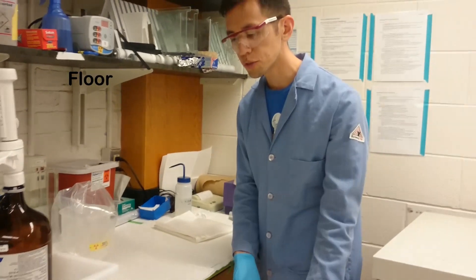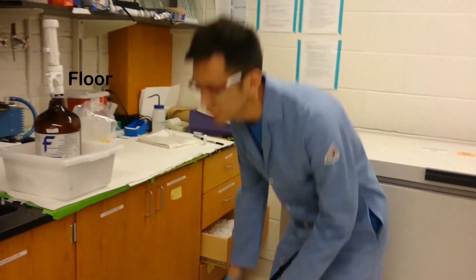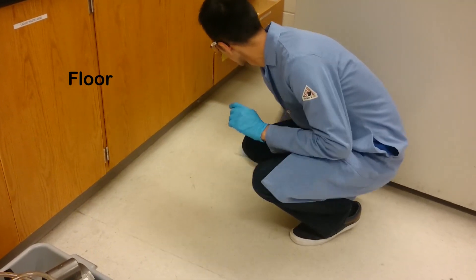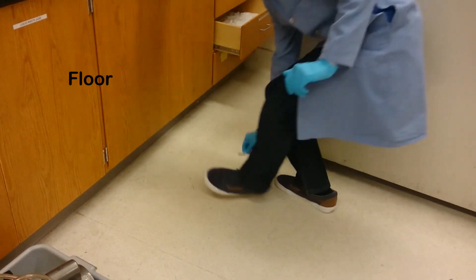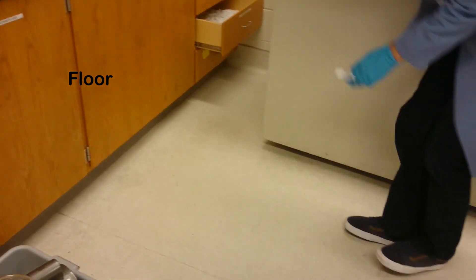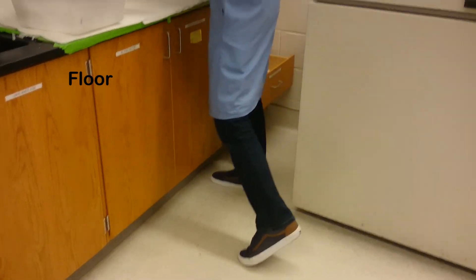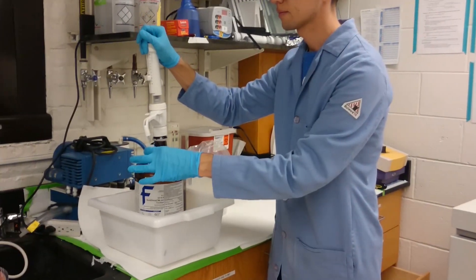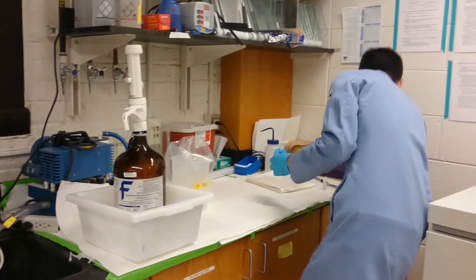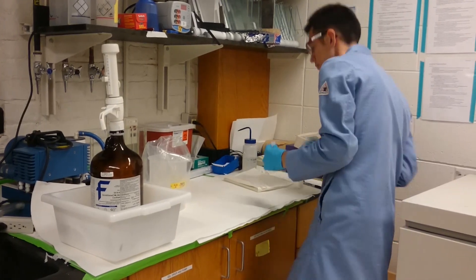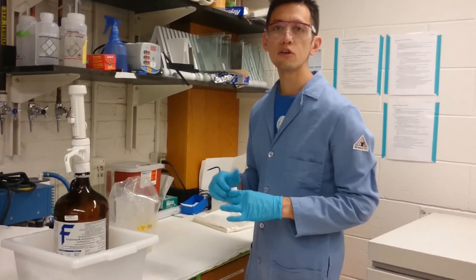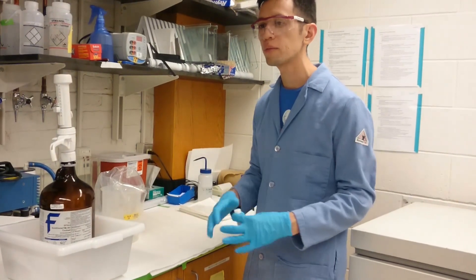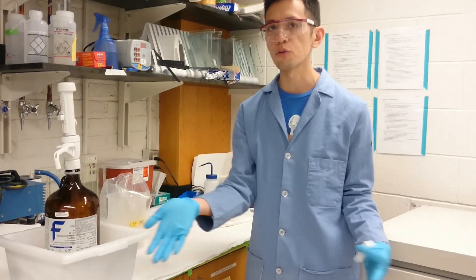So I've checked my coat, my shoes, and I'm going to check the floor. Obviously, if you're working in more than just this area, you're walking around the lab, then you would check more of the floor where you were actually working.